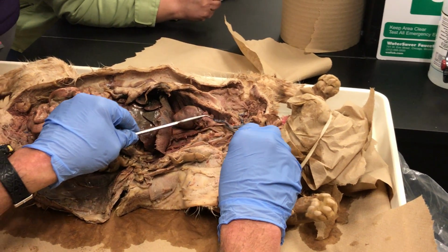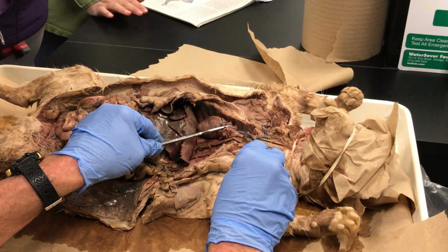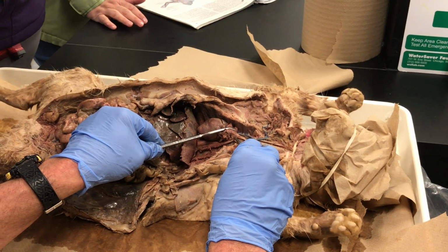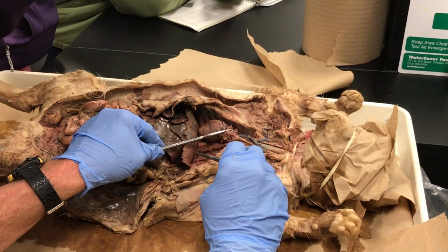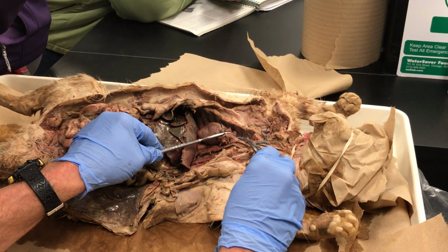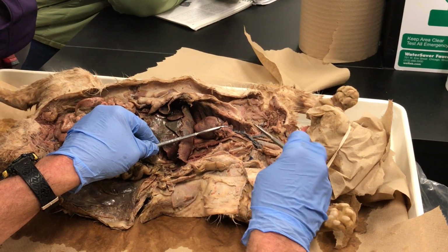In human anatomy, this common carotid does not come off the brachiocephalic. This tube actually anchors to the aorta. You guys have noticed on the human chart and on the heart model, there are 1, 2, 3 pipes that come off of our aorta. There's a brachiocephalic, a left common carotid, and a left subclavian. So the cat's a little bit different.